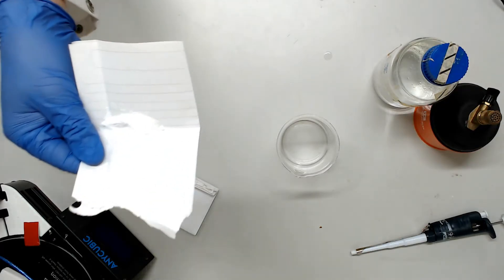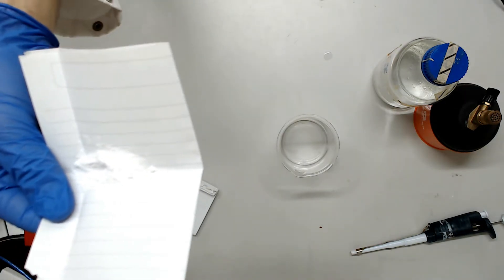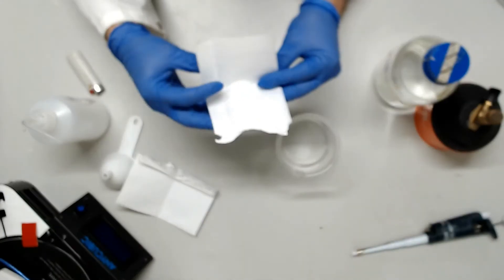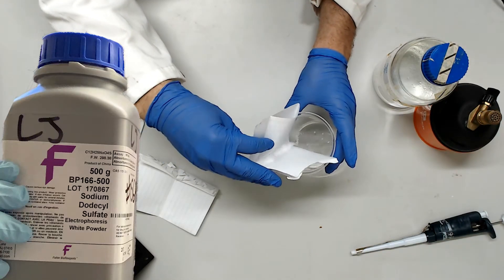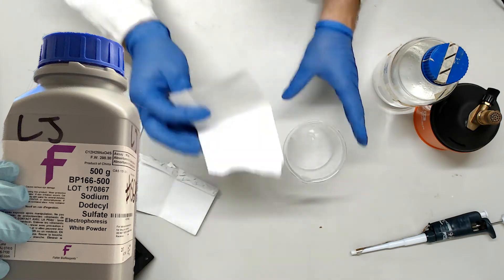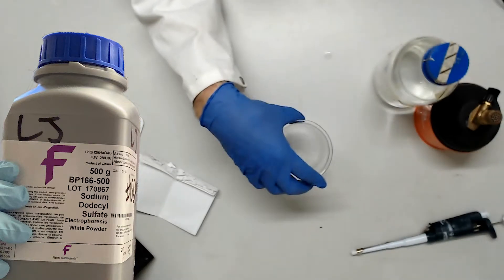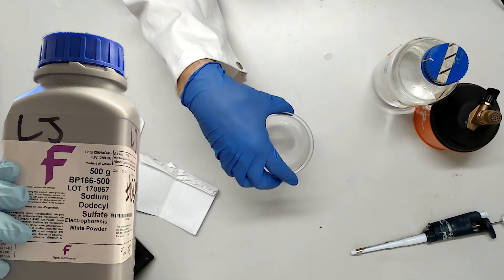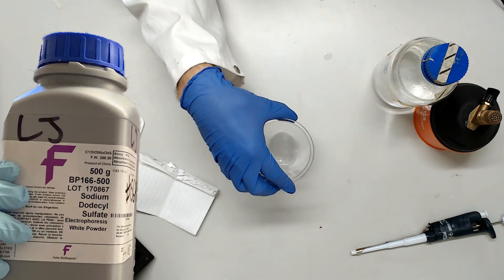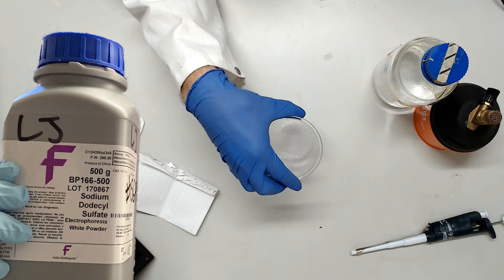SDS is a similar story. Powerful detergents can be as effective as strong acid when they get on your skin or in your eyes. As an added twist, SDS will often come as a very fine powder that will be flammable if a bunch is knocked up into the air. Avoid using a Bunsen while dissolving SDS. You really won't need a sterile environment except when obtaining water from your sterile bottle. If you've long monkey arms like our demonstrator here, try to get a bigger lab coat than the one he is wearing. Those exposed wrists are making me nervous just looking at him.